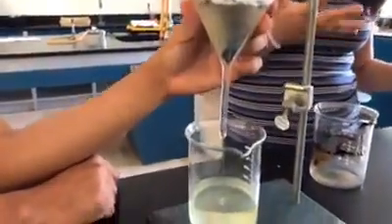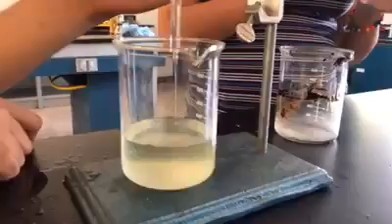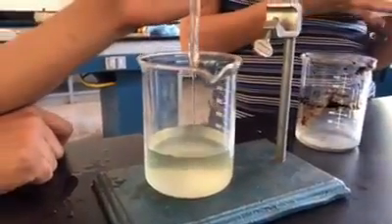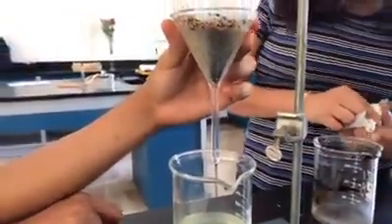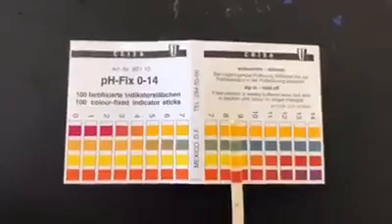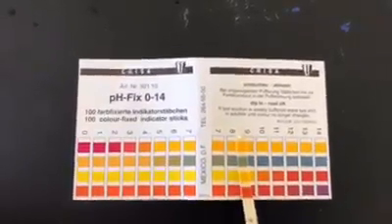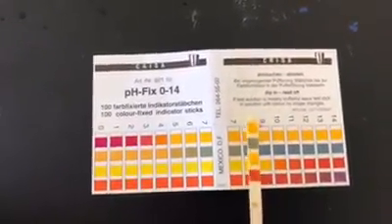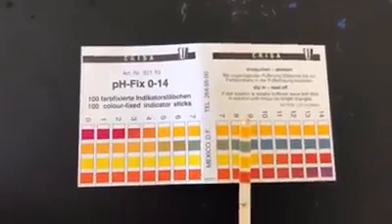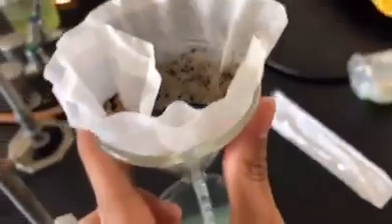In this case, we used a method that was easy to apply in the laboratory. Because of the lack of material, we used filtration to separate the oil. Our conclusion is that this method is not practical because, as you can see in the following pictures, at the end we could not remove 100% of all the components of the oil from the water, and there were still some chemicals, so we will need a more accurate method for this task.